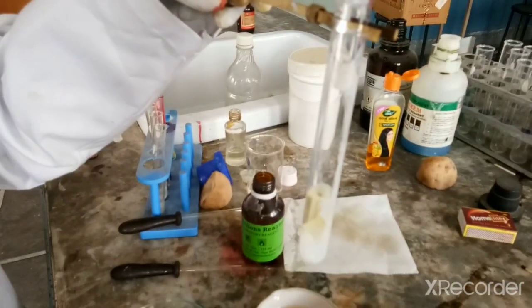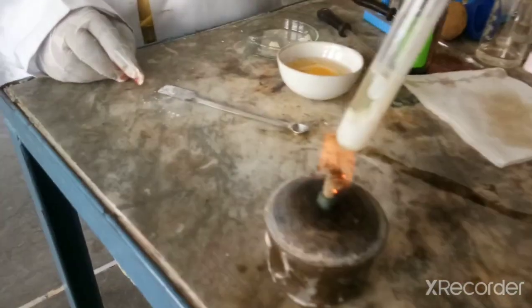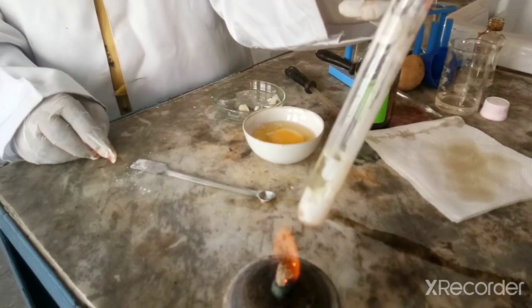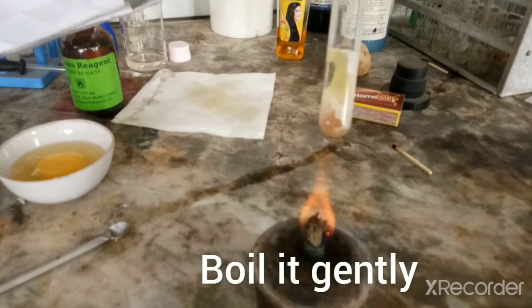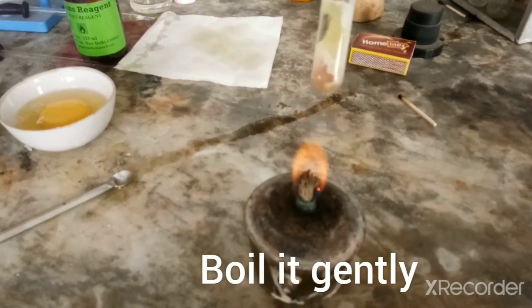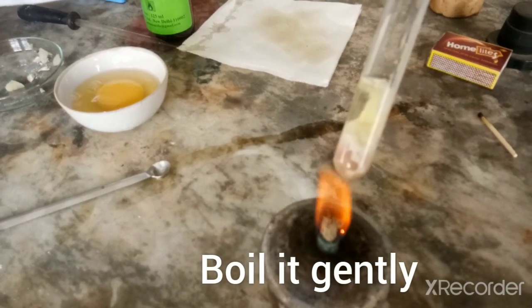You can notice here it has coagulated in white color. Now we will boil it. You will notice that its color will change from white to pink, which shows the presence of protein. You can see it is very much visible that it has turned pink in color.